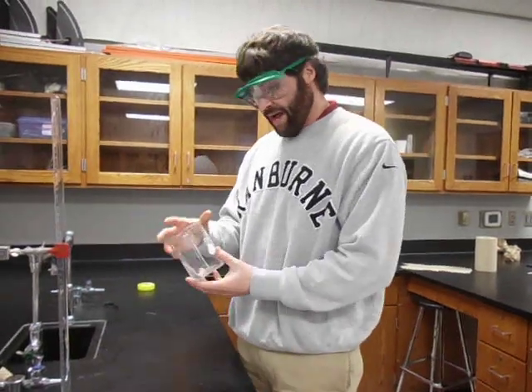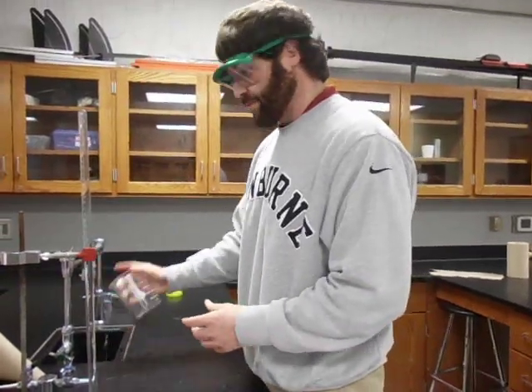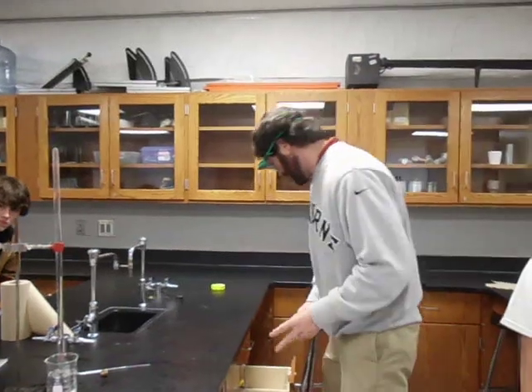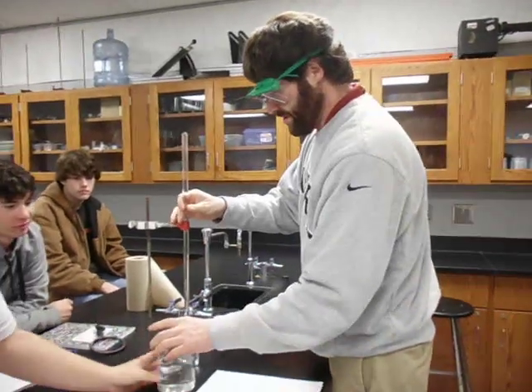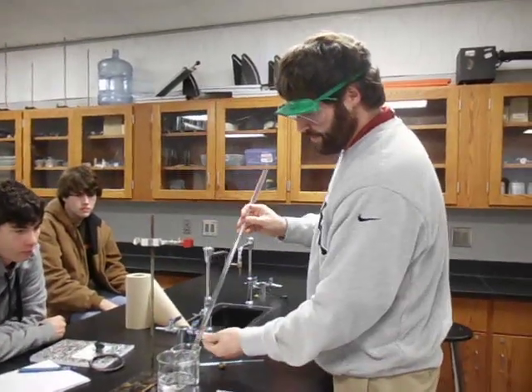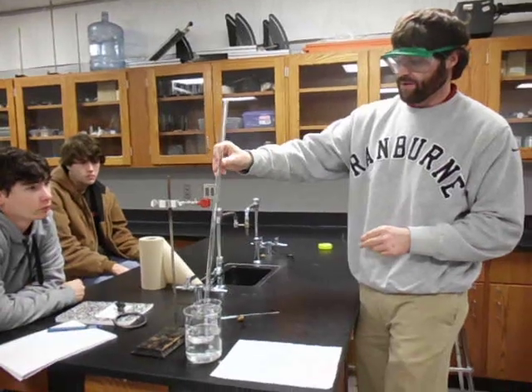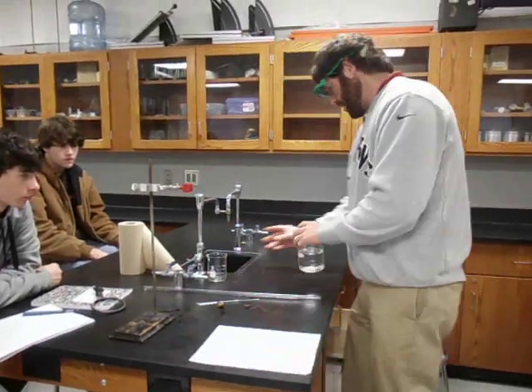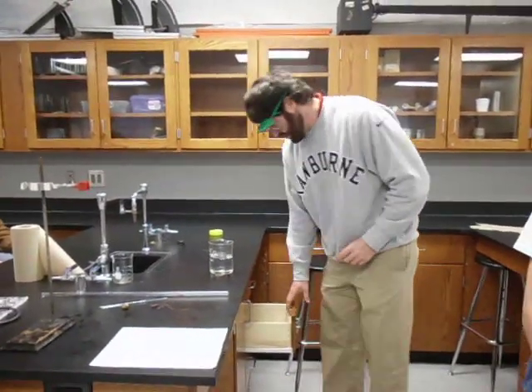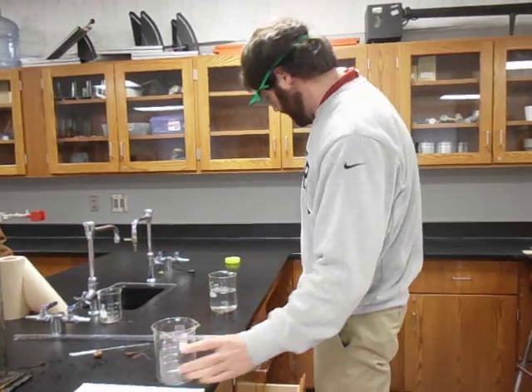When you're ready to do this for real, I'm going to need 270 milliliters of distilled water. Before you do the lab, go ahead and rinse the tube out with some distilled water to get it good and clean. I'll need a 500 to 600 milliliter beaker to mix everything in.